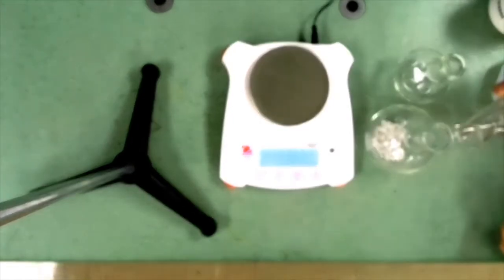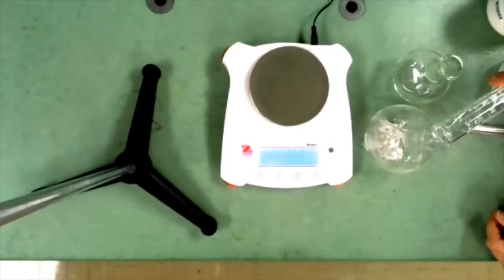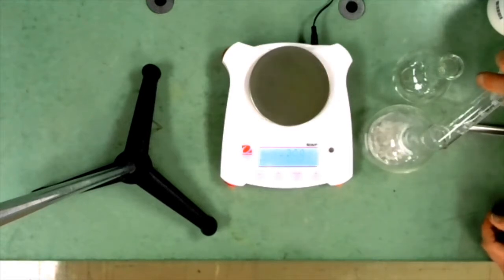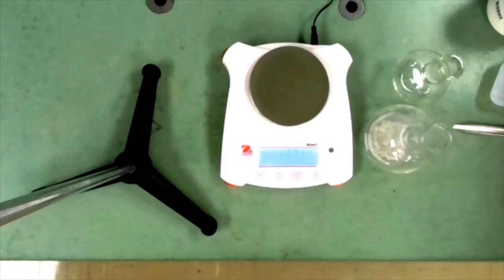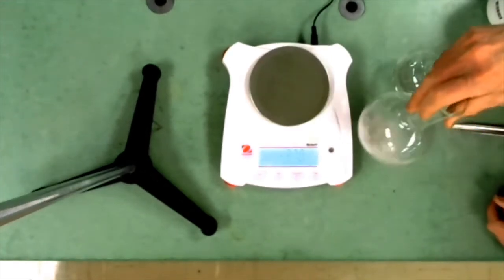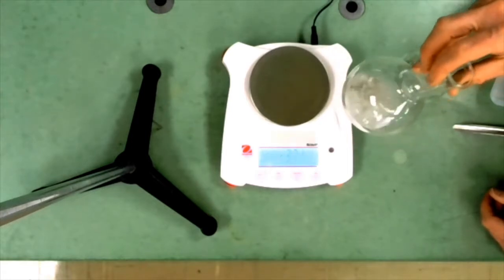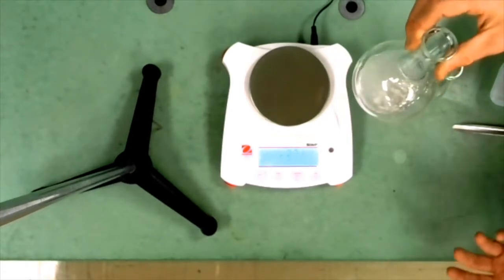Next we add 50 milliliters of water to the marble chips. And as you see, it does nothing. The marble chips do not react with water. They do not dissolve in water. Marble is a rock.